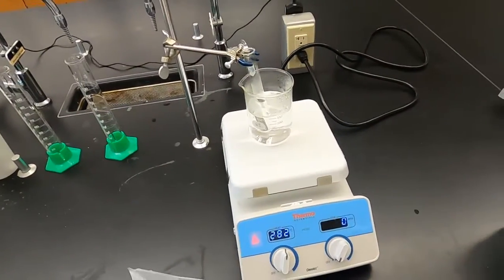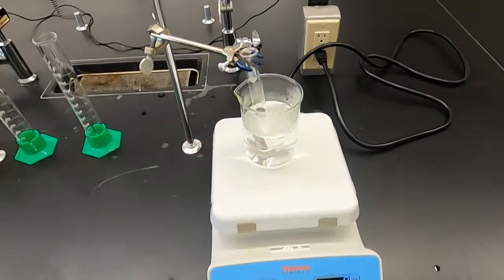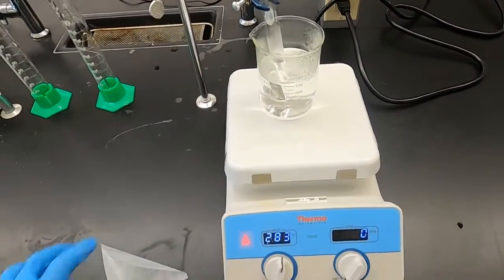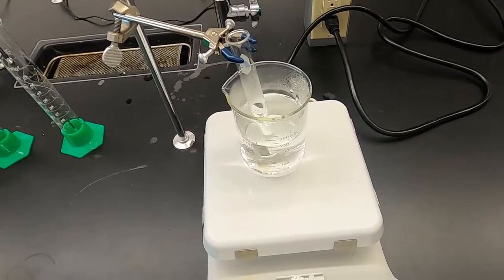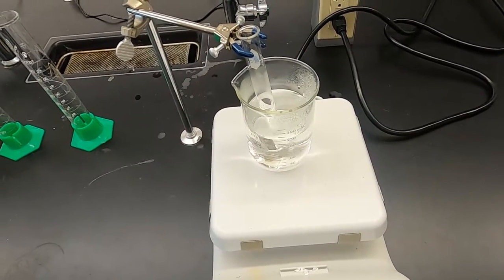So it's been about, well, it's been 13 minutes actually. So again, that's fine. Water's boiling. This is a constant temperature on this piece of metal. So we know that at least the water is 95 to 100 degrees Celsius. The metal probably isn't that much, but it's gotta be close.